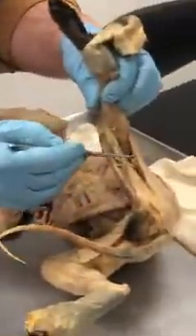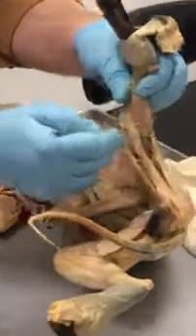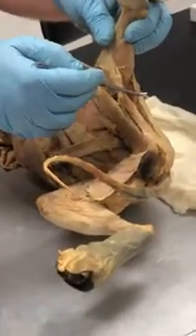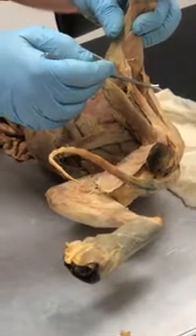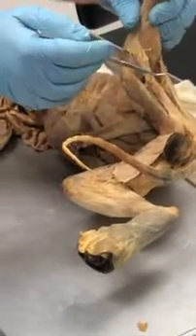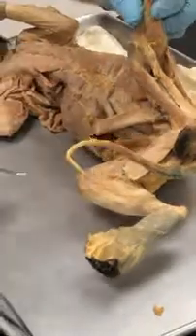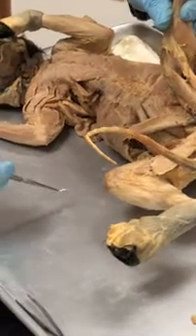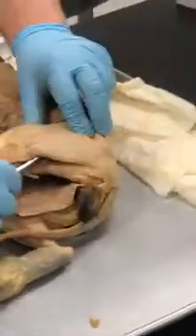What's this muscle here? You didn't see it from the same angle. If I do it this way, what is this muscle over here? If you see it from this angle, you can see it. No, think of hamstring. Lateral side. Semitendinosus. Oh, lateral side. We're doing so good. Biceps femoris, right. So here's the biceps. This is the biceps femoris. Oh, the whole thing. Right, that's really big.